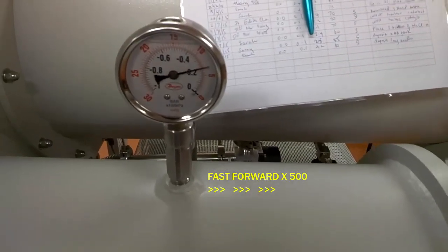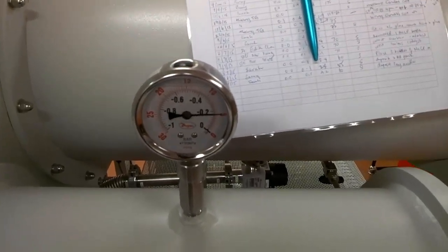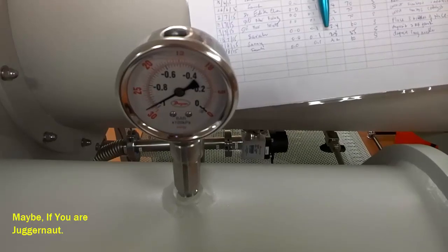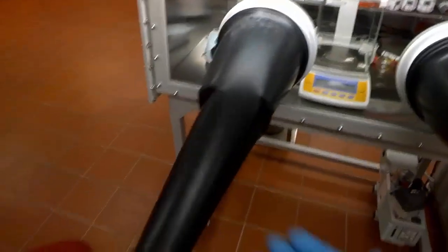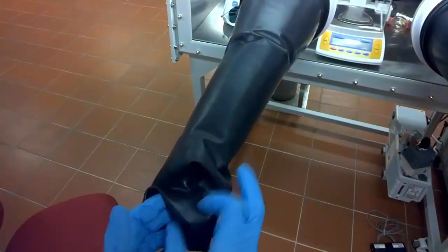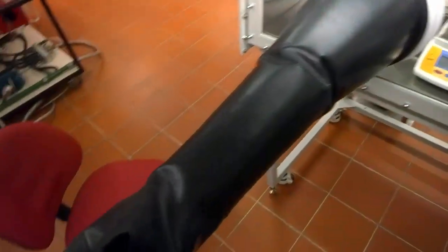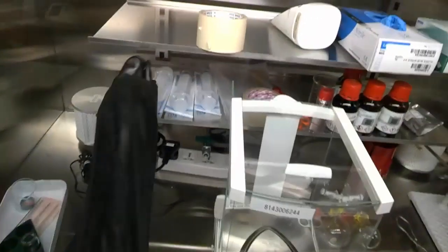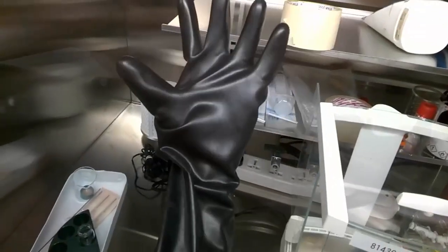Remember, before we insert our hands inside the box glove, we have to ensure that the antechamber is filled with nitrogen, not vacuum. Because after you wore your gloves, if you are trying to open the door which is under vacuum, you cannot open even if you are a Hulk. Once it is filled with nitrogen, we rotate the valve to the middle. Now we insert our left hand first inside the box glove, using your right hand to guide your fingers in position. Once your fingers are inside the cavity, be confident and push it in all the way. Stretching out your fingers. Loosen them. You see my hand? Make sure you have dexterity over here. Your fingers can move about without being restricted in any way. So it's all good. Hello.